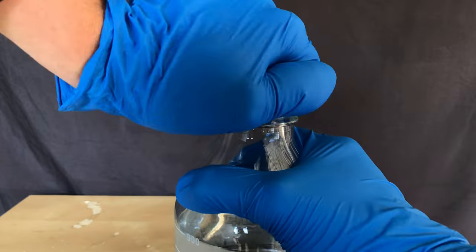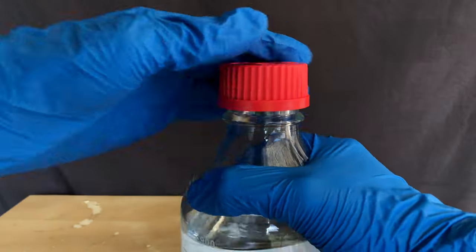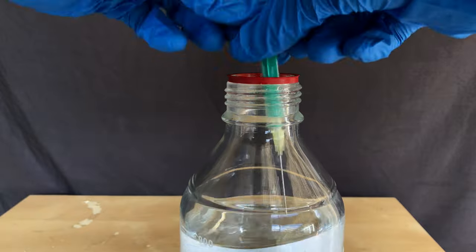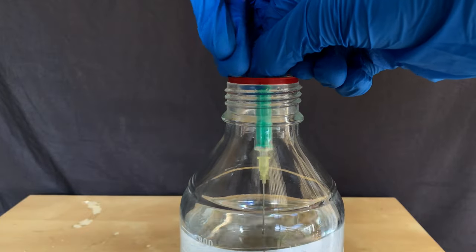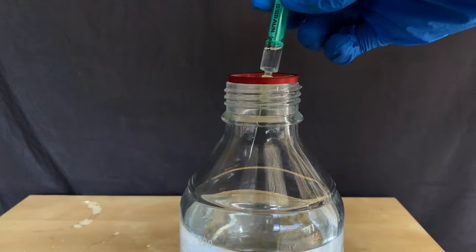Therefore we are going to make the acetate ester. Because I'm lazy and I don't like to wait, I am going to use acetyl chloride as an acetylation agent. About 2ml of it were used, which is a huge overkill.